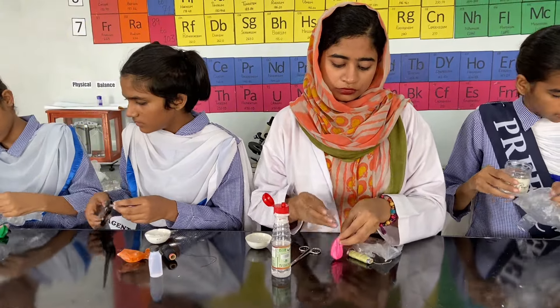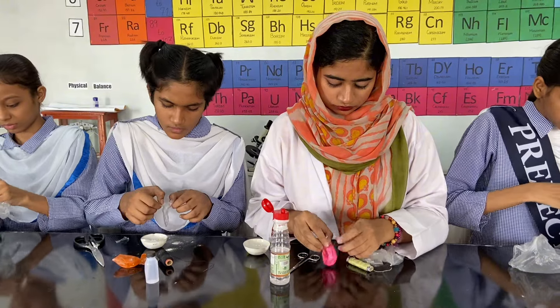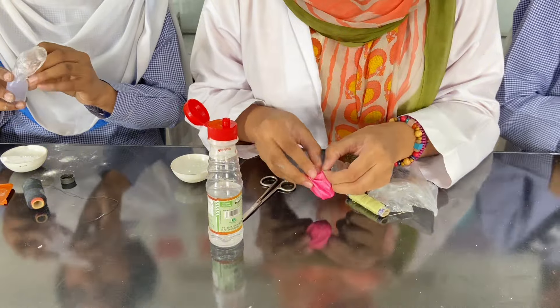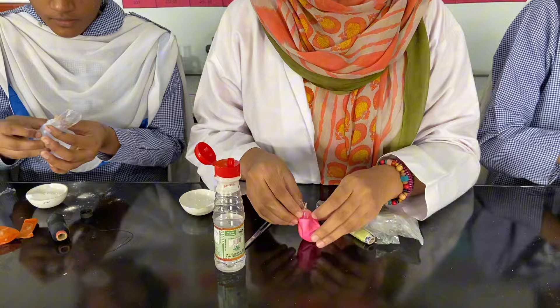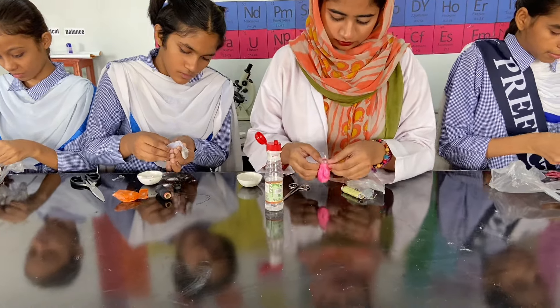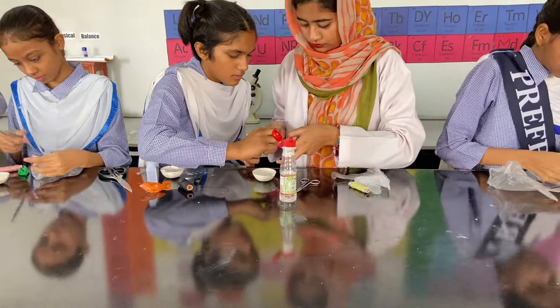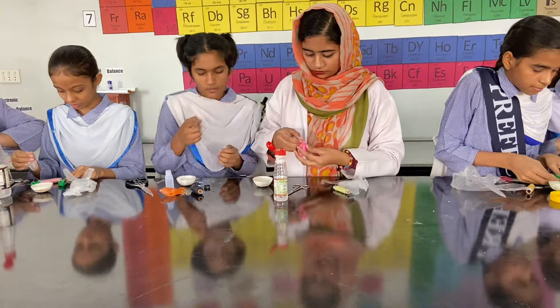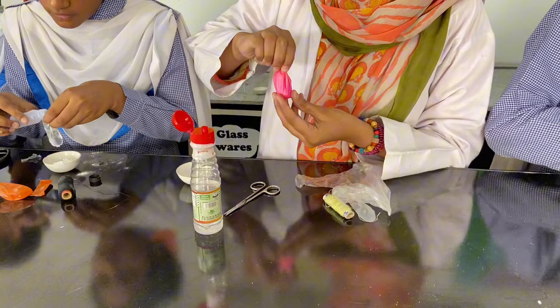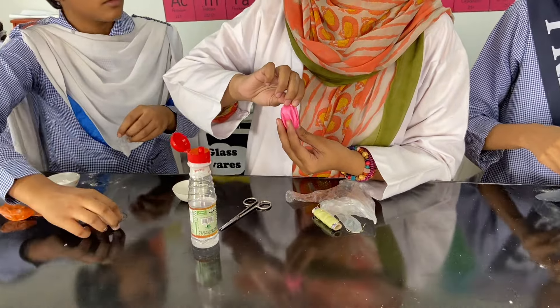Take it gently inside the balloon. So in the meantime we will add this vinegar. Now we have to pack the balloon tightly so that no air or carbon dioxide that will be formed after the experiment will come out.